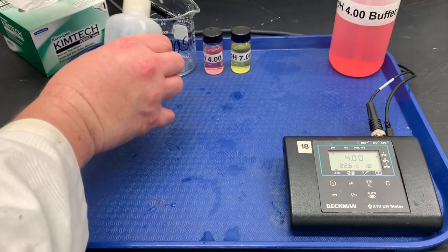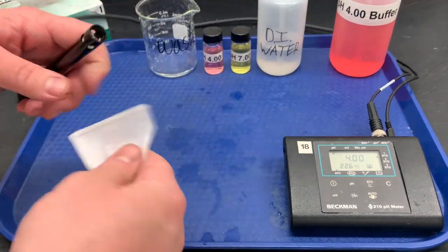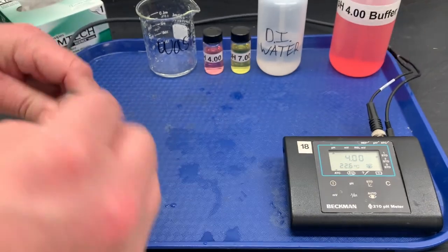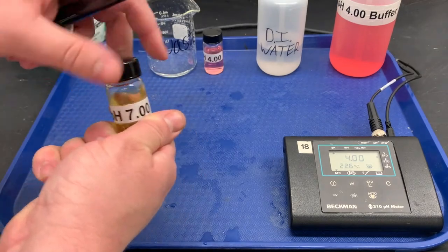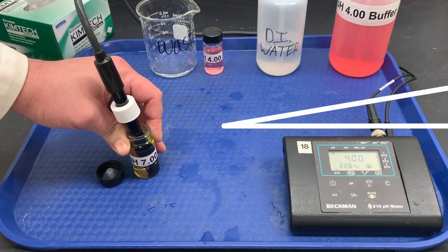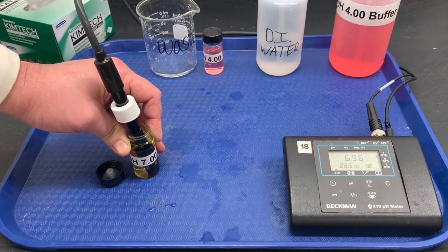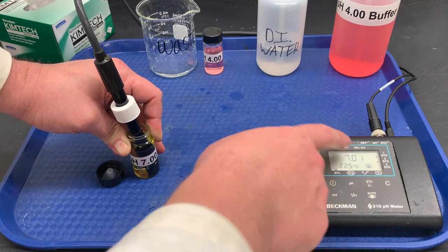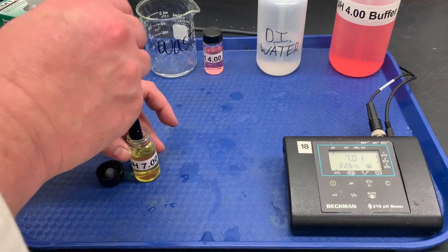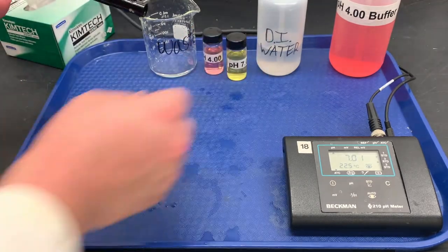Now we're going to do one more standard — you could do three standards, but we don't need to today. Rinse with DI water and blot dry, because we don't want to hurt our electrodes but we also need to get the water off since it alters the pH reading. Take our second standard, stick that in, and hold it for one minute. Press Standard again and you can see it's calibrating our second standard. A variation of 0.1 is acceptable.